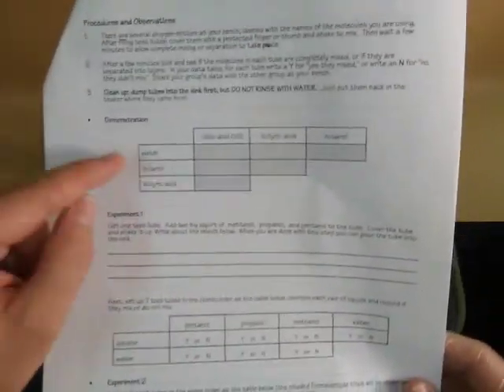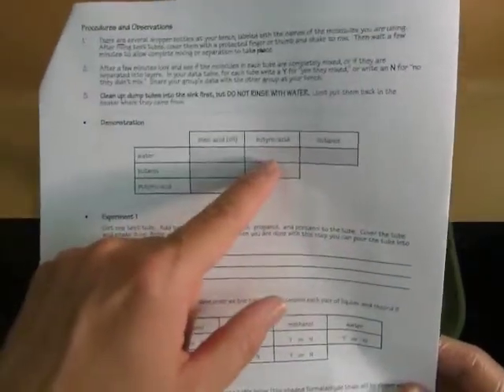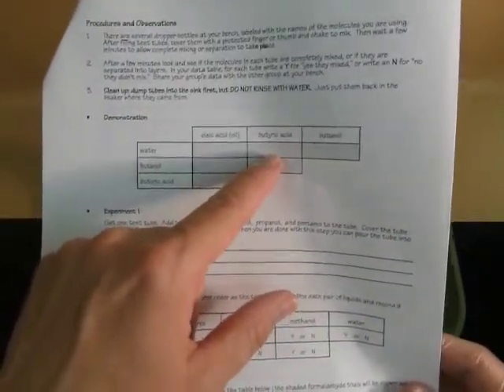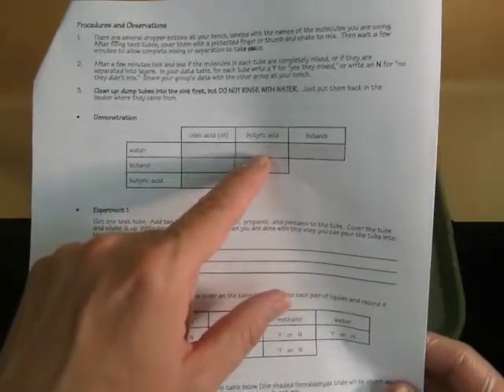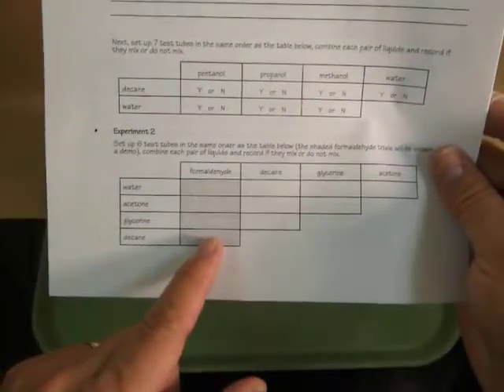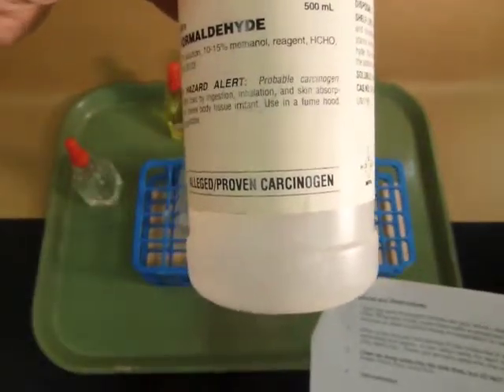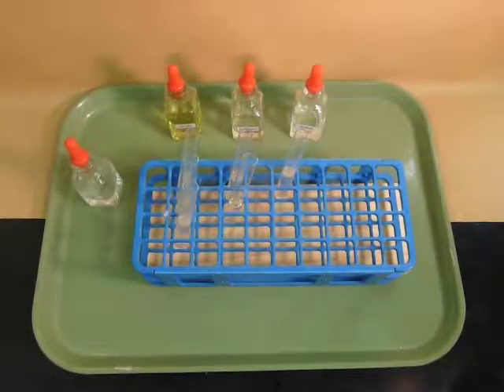The reason why I'm doing the demonstration here is because one of the molecules that's being used, butyric acid, is what gives vomit its smell. And only a drop of it is what it would take to fill up this whole room with the bad smell of vomit. So we don't need that one in the room today. The other one, formaldehyde, I don't want you to use because according to the label, it is a proven carcinogen. That means that it causes cancer. So that's not one that I want to have you work with at the bench either. So I'll demonstrate the procedures and I'll use those as my examples to show you how to do the steps yourself when you go back to the bench.